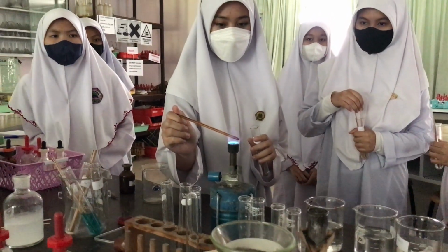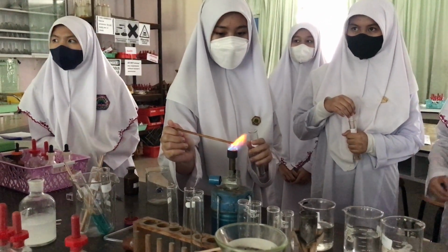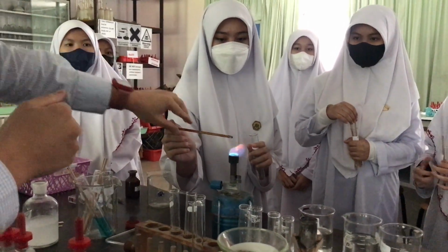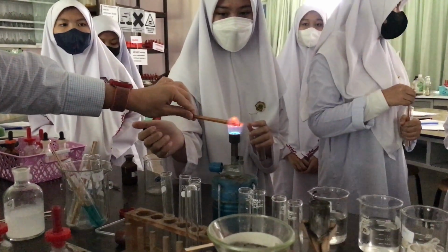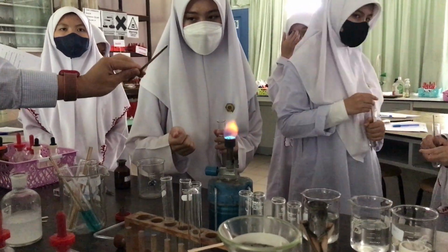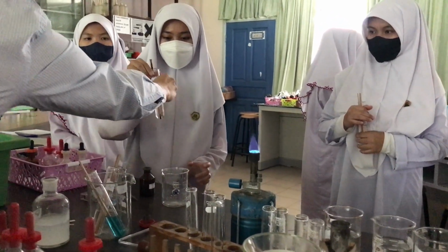You see the red color? Yes. Is it quite clear? Oh yeah, people can see the red color now, right? Don't burn the wood. When it starts to burn, just flick it the other way around. Do you see the red color? Okay, this is the color of Li plus. Understand that? What color was that? Li plus. Now, what color was the solution?